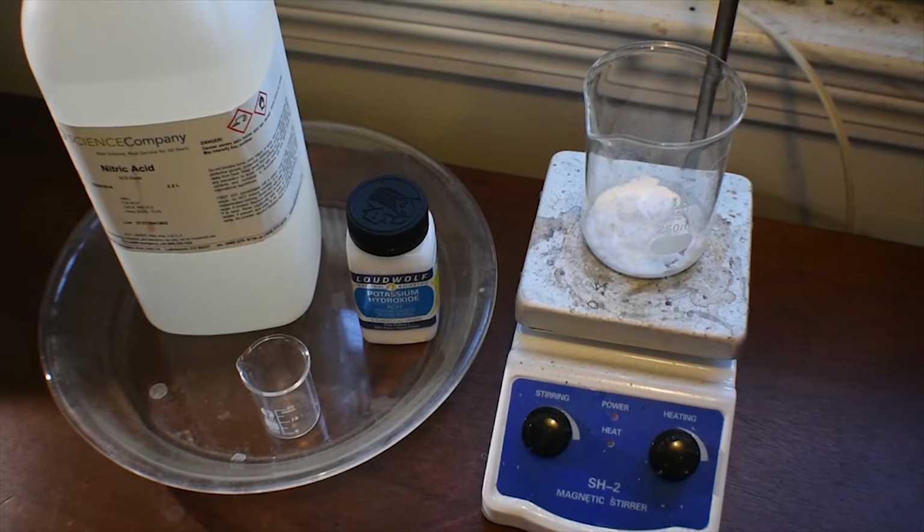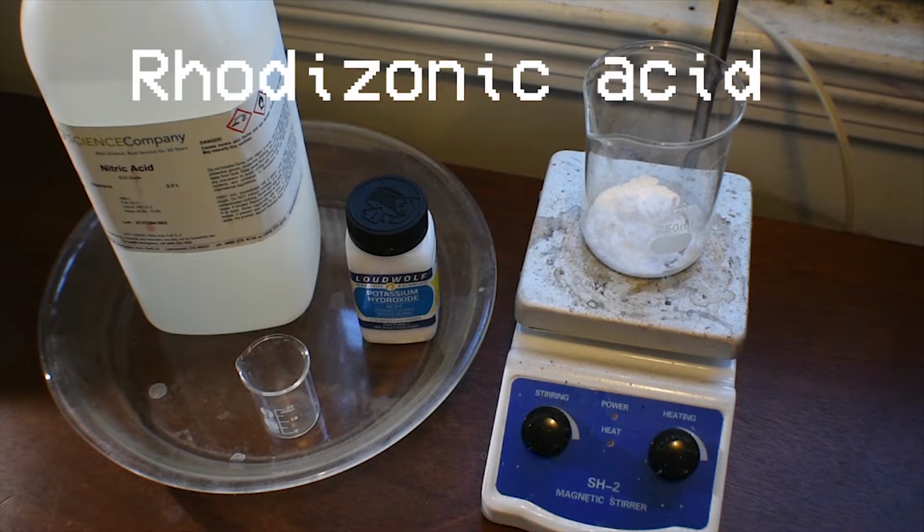Everyone, welcome back to another video. Today I'm going to show you the synthesis of rhodizonic acid and potassium rhodizonate.